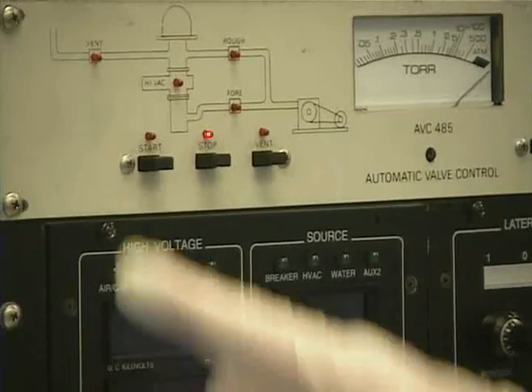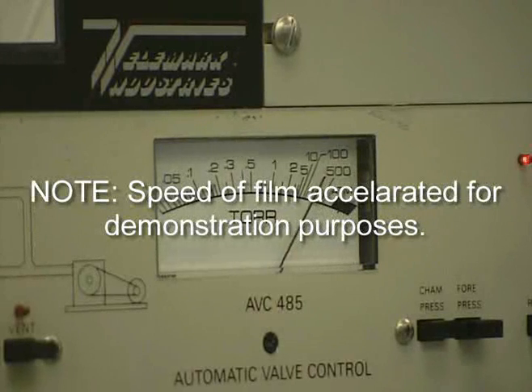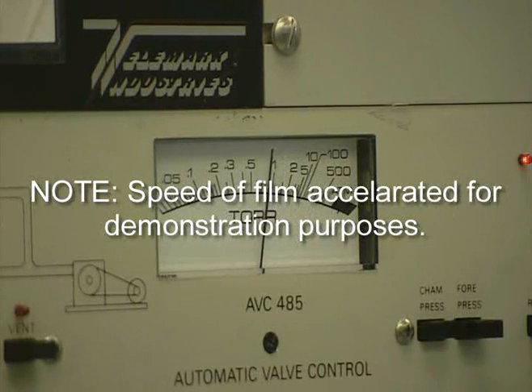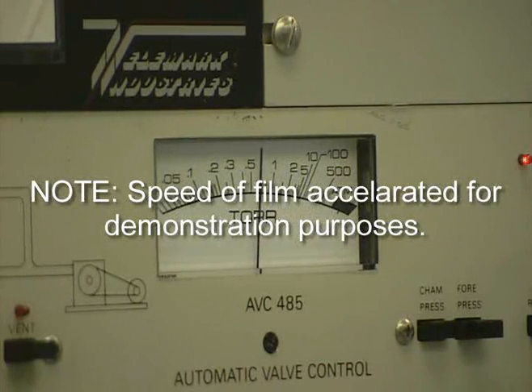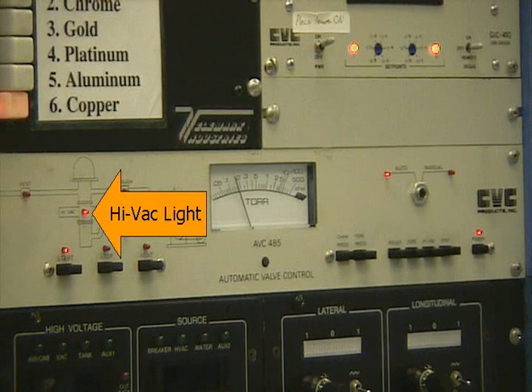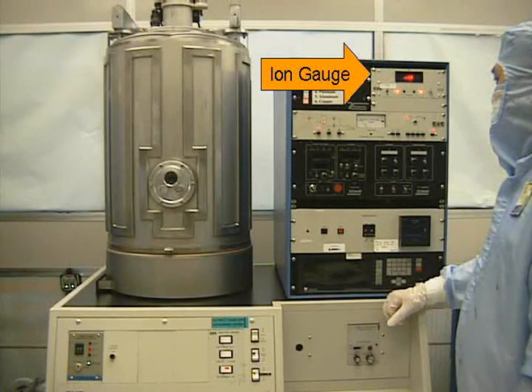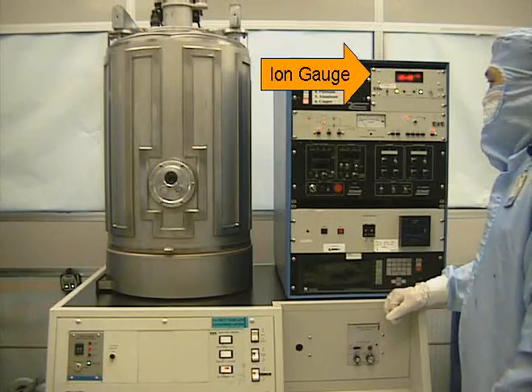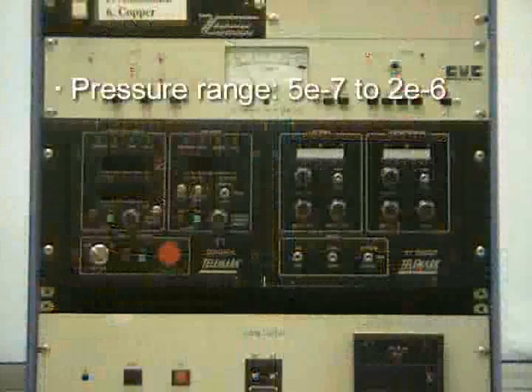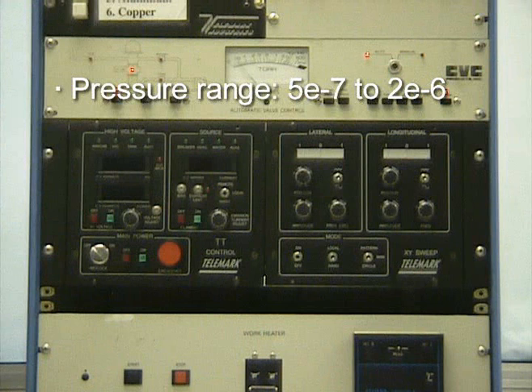Now hoist the chamber down by pressing the hoist down button on the hoist controller. Once it has been hoisted down, press the start button on the valve controller. This will start pumping the pressure of the chamber down. After a few minutes, the chamber pressure needle will start moving and go down to about 0.5 torr. The high-vac light will then come on, indicating that the valve is open for the cryopump. Soon after, the ion gauge controller will come on. This is indicated by the lights on the ion gauge controller changing from red to green and the counter displaying the decreasing pressure of the chamber. We will wait for the pressure to come down to about 5 times 10 to the minus 7 to 2 times 10 to the minus 6 range.